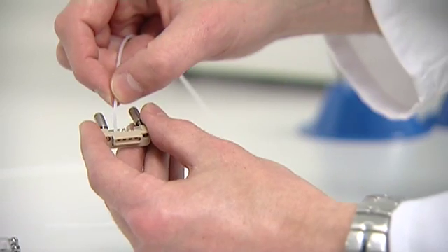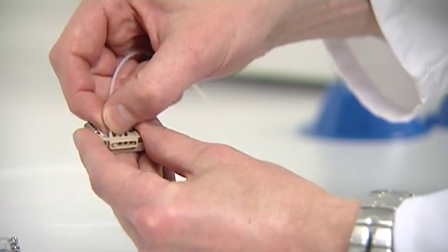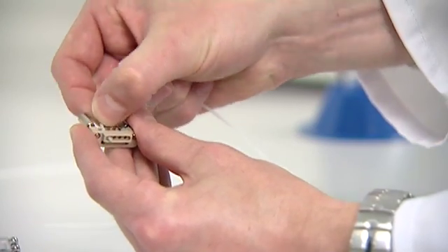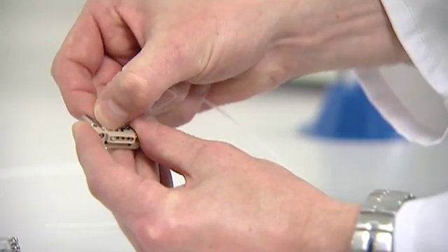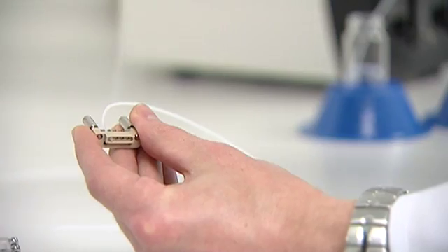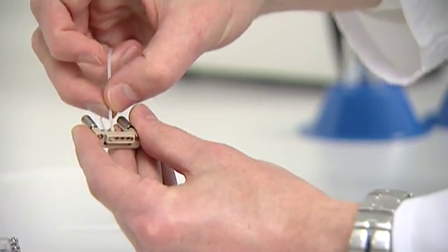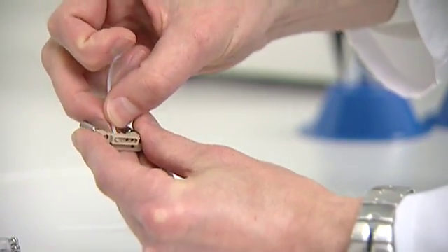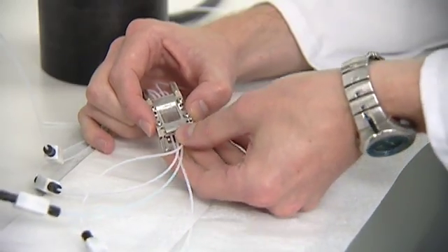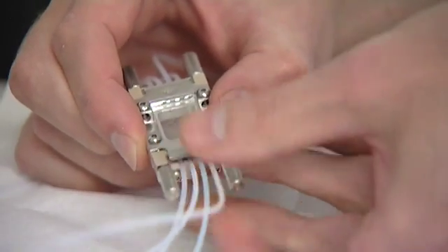First, we connect tubing into a Dolomite edge connector. Each tube is pushed into the connector and then aligned and locked into place. This takes a few seconds and needs no tools. Then the edge connector is fitted to the chip holder.